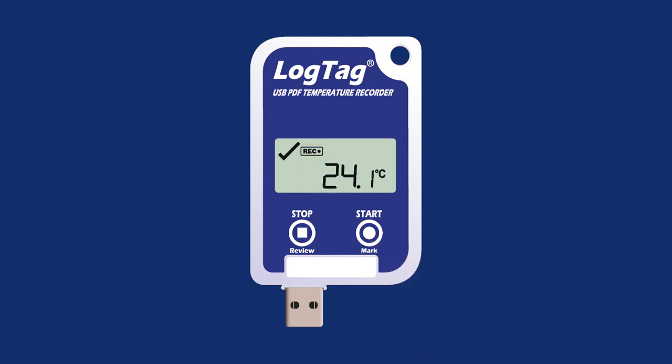Once logging has successfully begun, the temperature from the latest reading taken will display on the screen, along with a tick mark to show there have been no alarm excursions. If the recently recorded temperature is above or below the alarm threshold, a single arrow will appear on the logger indicating whether an upper or lower alarm threshold has been triggered. If an alarm event occurs, a cross symbol will display in the top left corner of the screen.